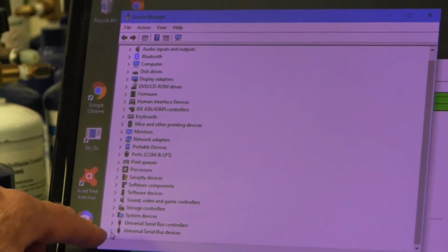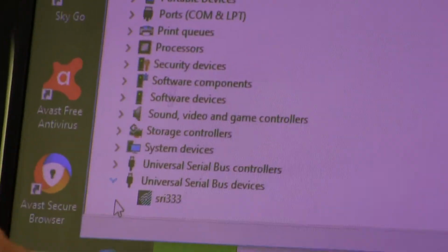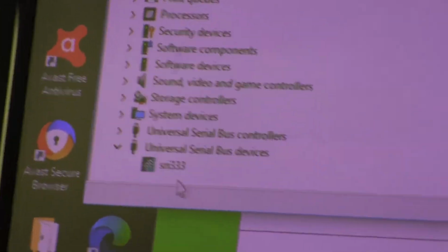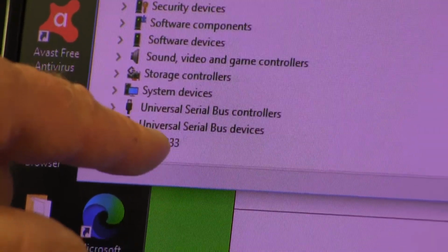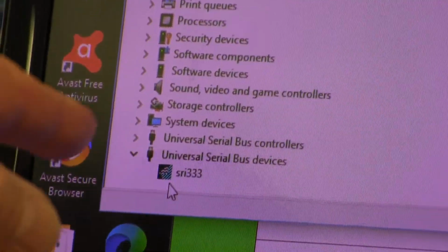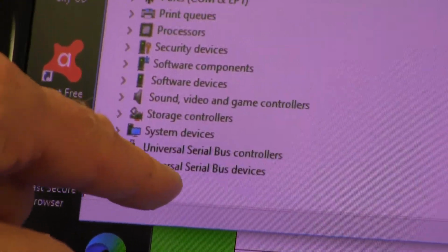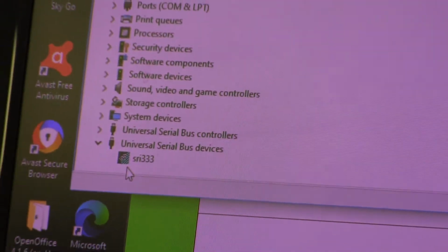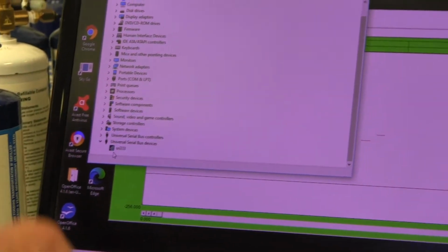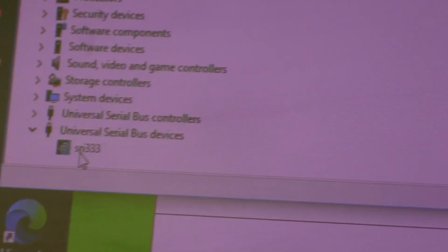If the driver is correctly loaded, and you expand this little arrow here down where it says Universal Serial Bus Devices, if the driver was loaded successfully, you'll see this icon that says SRI 333. Or it might say Lawson Labs 2. It depends on the type of hardware you have. But clearly that's our little data system that the computer has already recognized because the driver was loaded correctly.